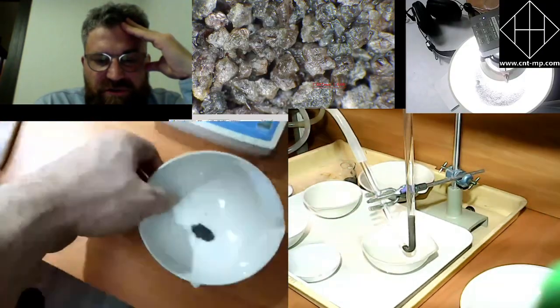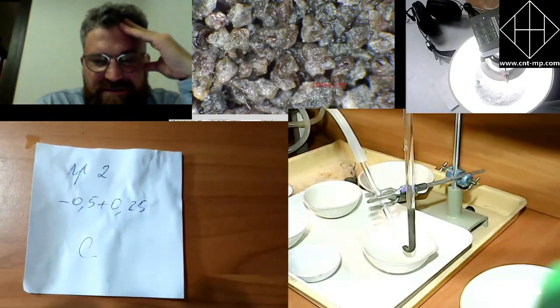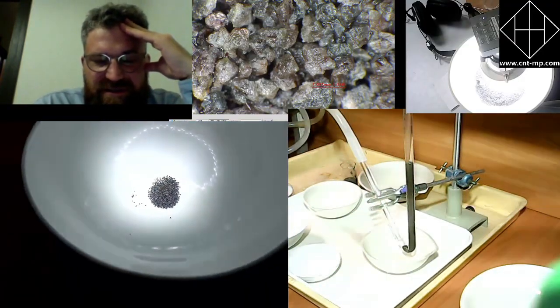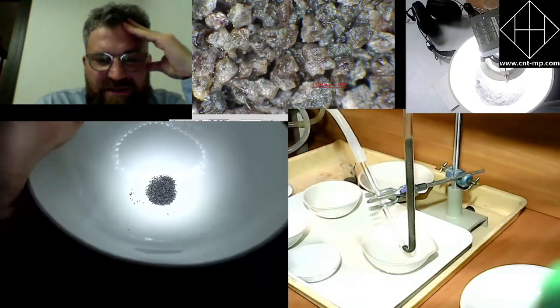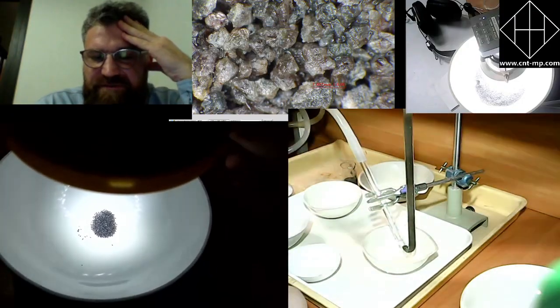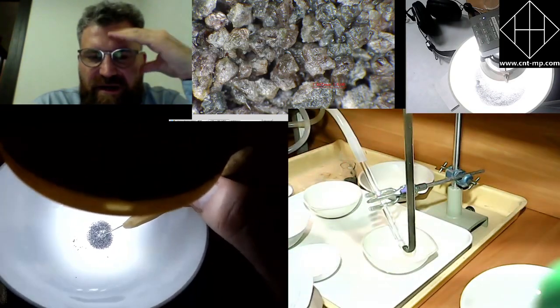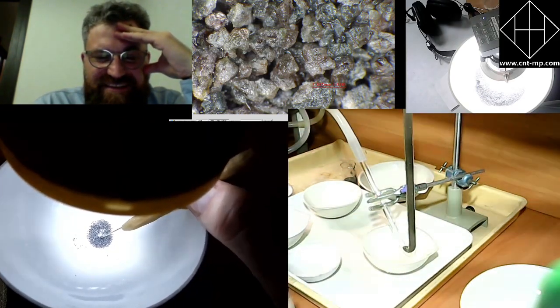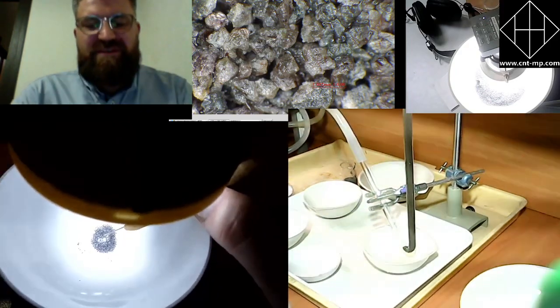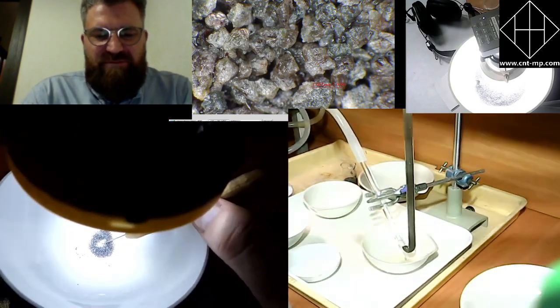So he will show you the hand picking. I guess the dishes are very hot. So he will be doing some hand picking on a previous amount of concentrate. He will be picking sulfides for you guys, and we'll show you the nice crystalline, I think, pyrite. We will release images in the course of our training, so you will be able to see that.